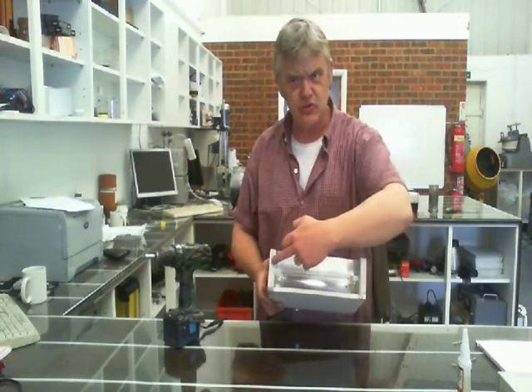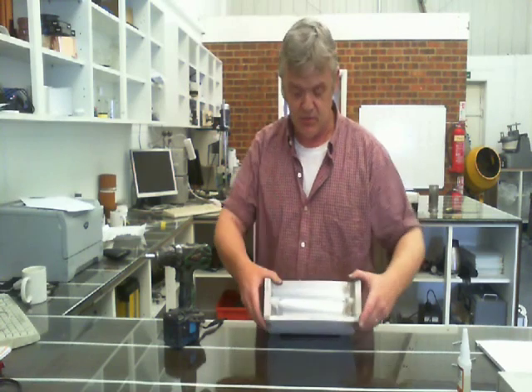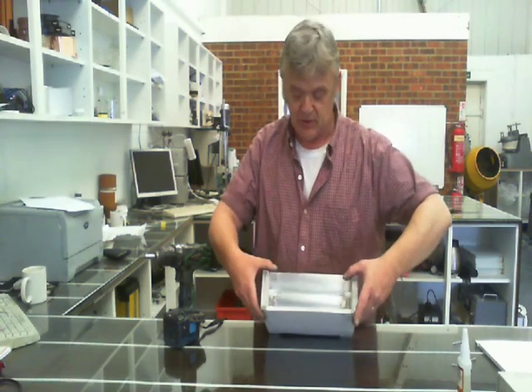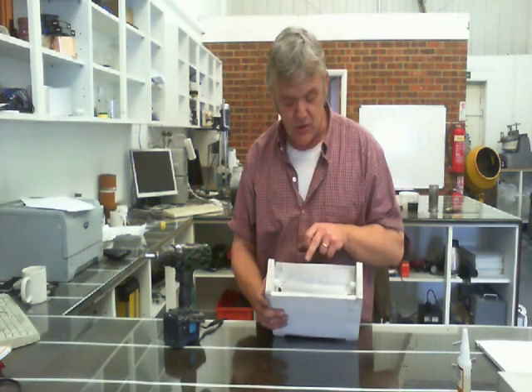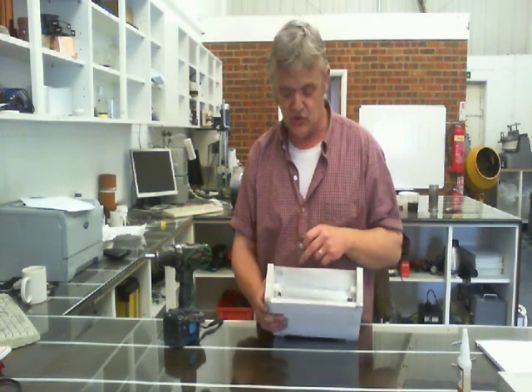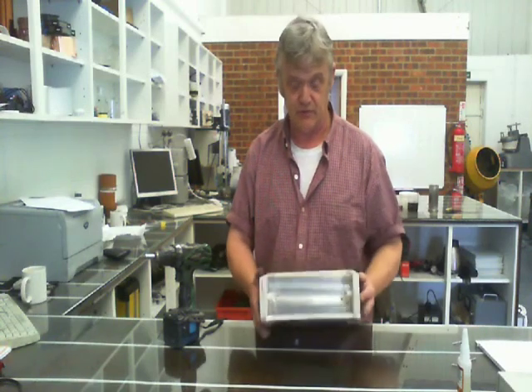Then I drilled those two sides out to slot the lamp in. The lamp's quite a tight fit, but you just have to pull those apart a little bit and then the lamp slots in. Now this is a reflector. I had a bit of aluminium and I cut some aluminium to the right size, cut a couple of holes in the top of it for the wires and bent it over and put it in as a reflector.